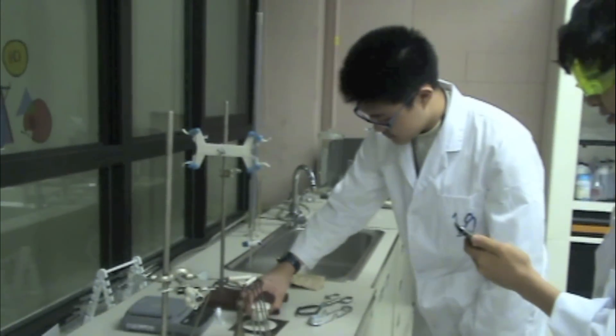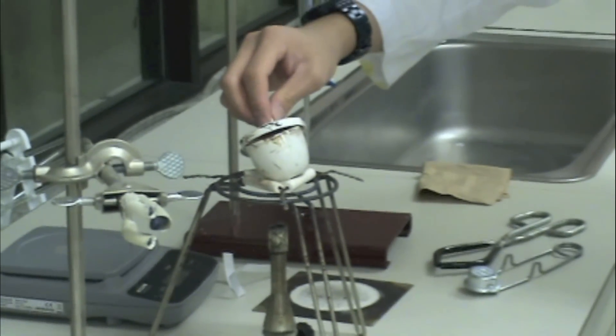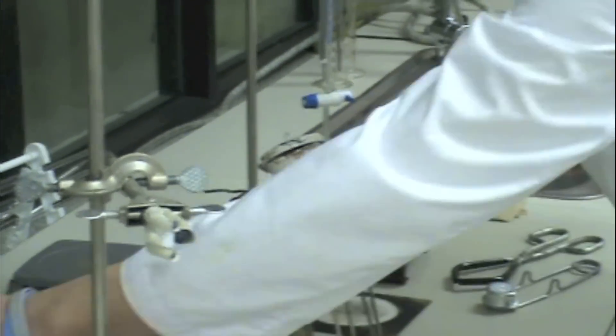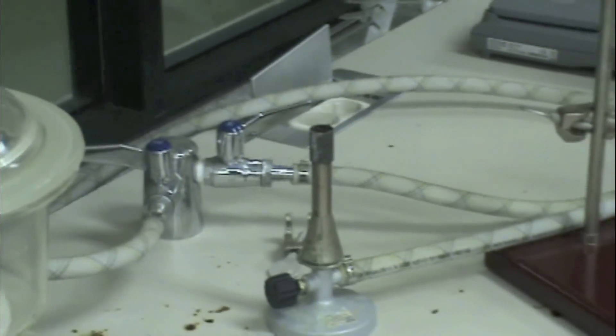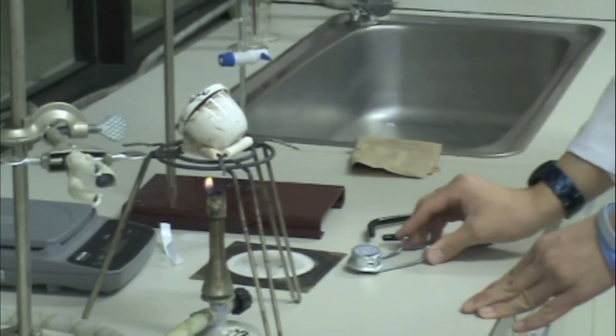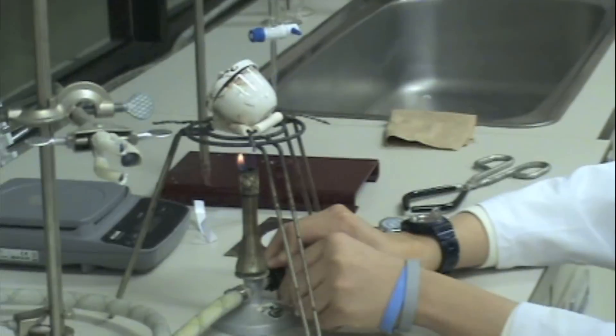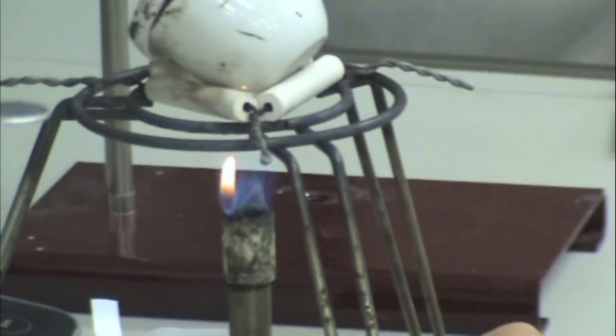Let's heat the crucible. Heat the crucible on a pipe clay triangle. Remember the wire gauze is where you put the crucible to cool. Now you'll need a Bunsen burner. Start with the small gentle flame. Control the flame of the Bunsen burner using the knob on the Bunsen burner. Start low and eventually increase it to a strong flame.